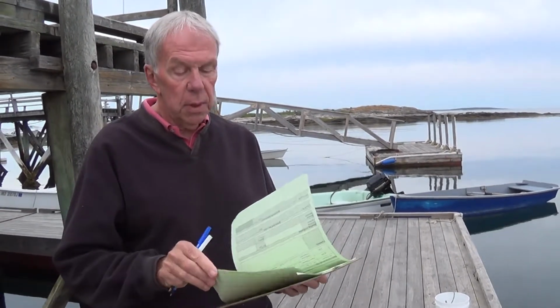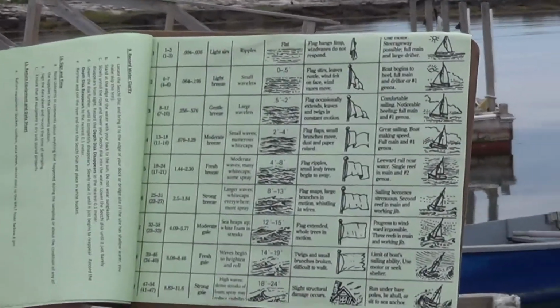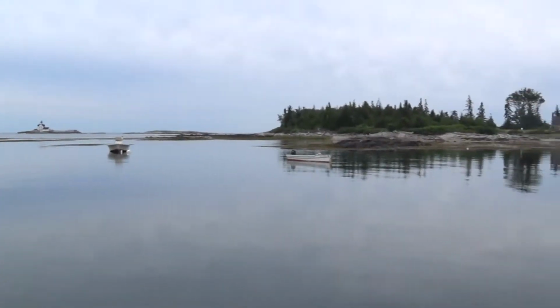So in the back sheet that you have, and you can look at the details later, there is a Beaufort wind scale, and it associates empirical characteristics, basically your guess as to how fast the wind is blowing, with a number. So if we can just pan on this harbor for a moment, it asks you for wind speed and direction.